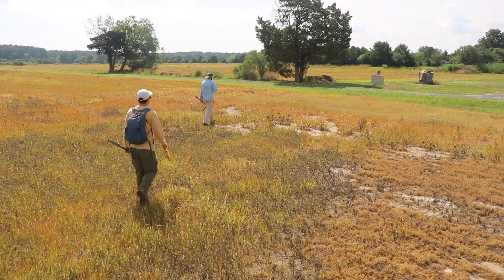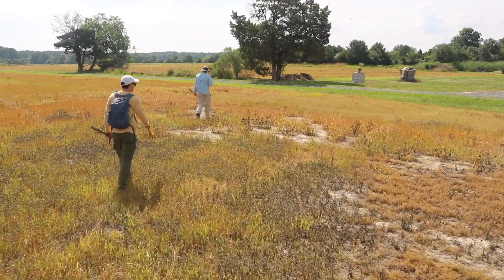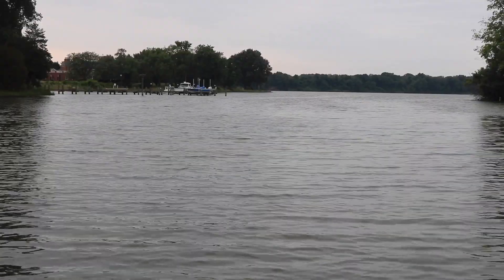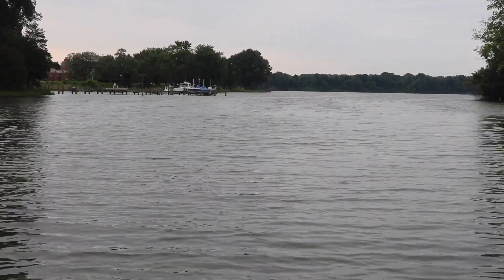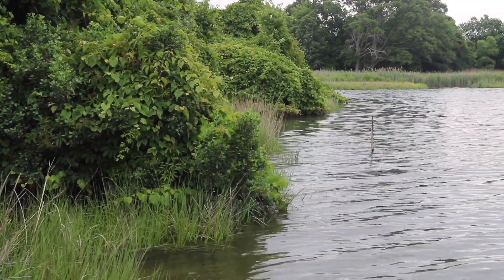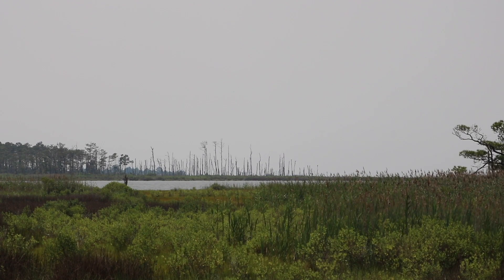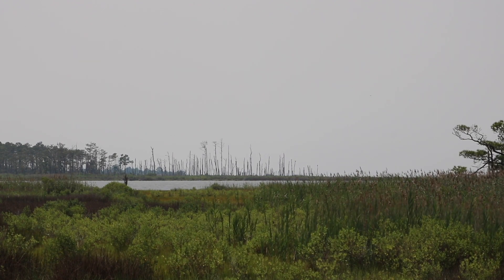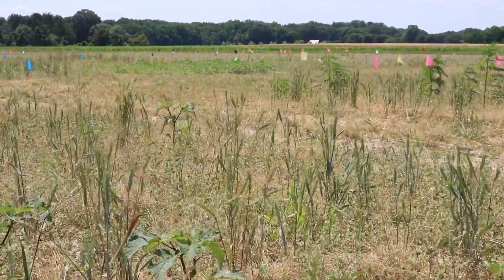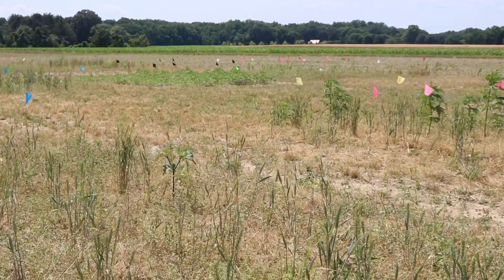The TIDES project is our way of bringing the field back to the lab. We wanted to be able to replicate the tidal processes that occur in our field sites in the lab, and then perform our experiments within this little mesocosm we've created.